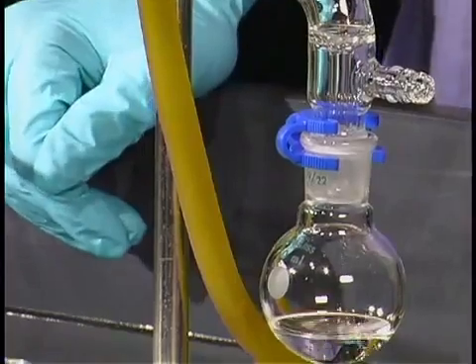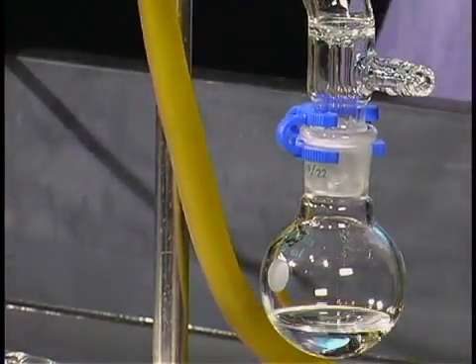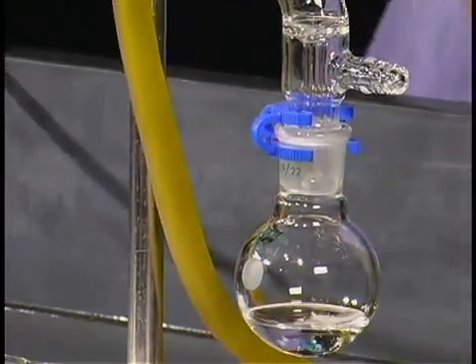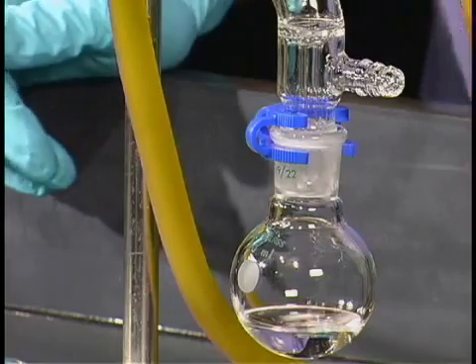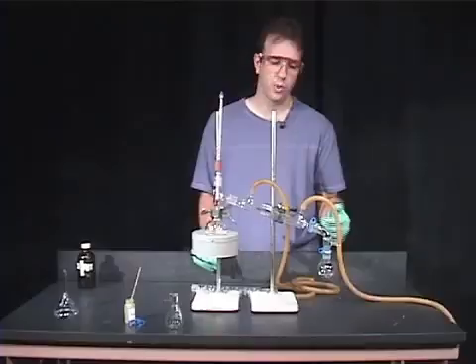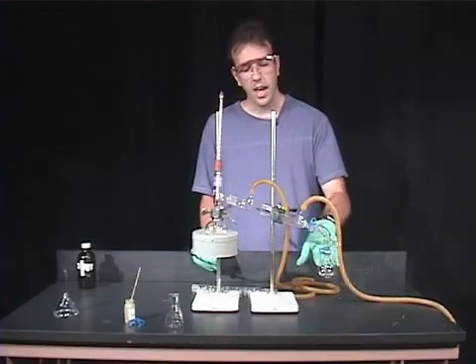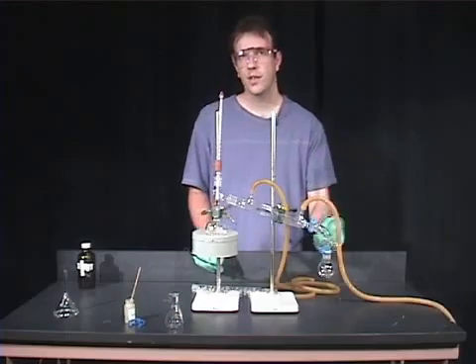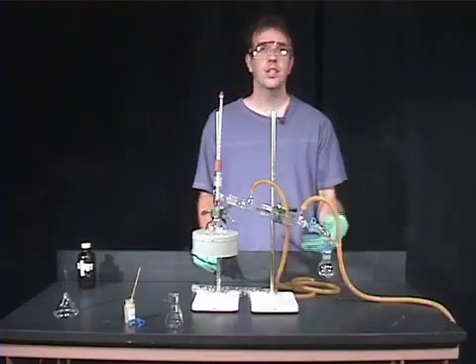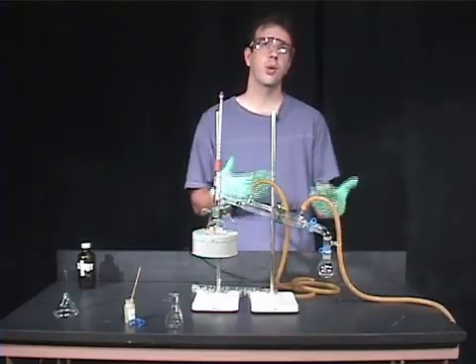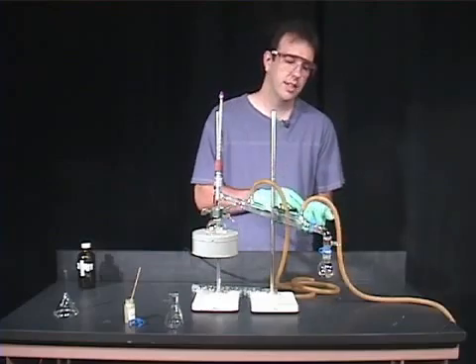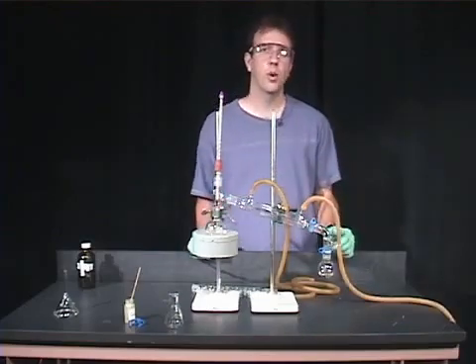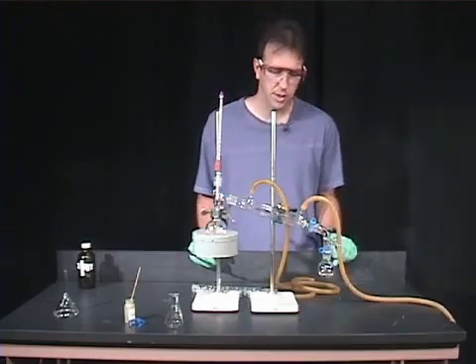When you do a distillation of any sort, you want to be able to control how quickly you're collecting the liquid, the solvent that you're boiling off. Generally, the rule is that if you have one drop coming out every two to three seconds, that's a good rate. This is probably a little bit faster, but this is a low boiling solvent, so that's generally okay.